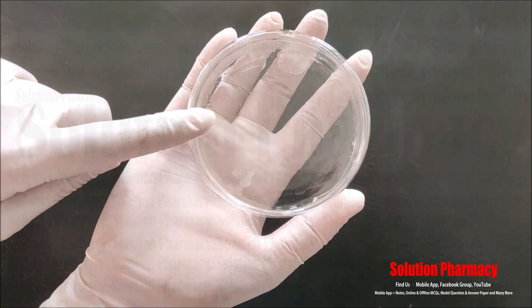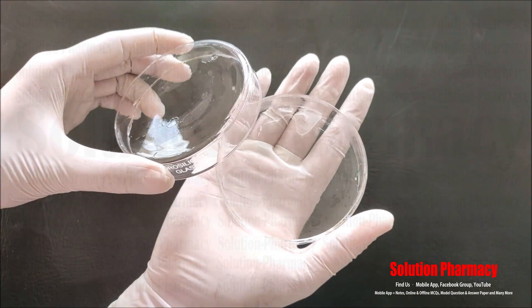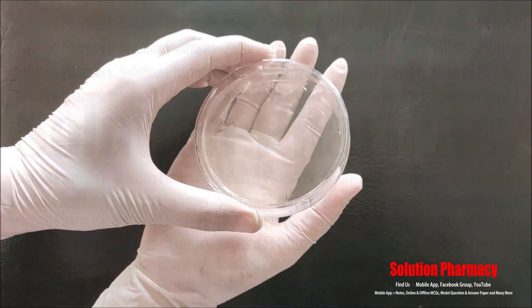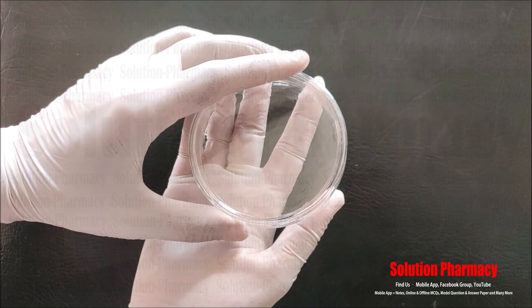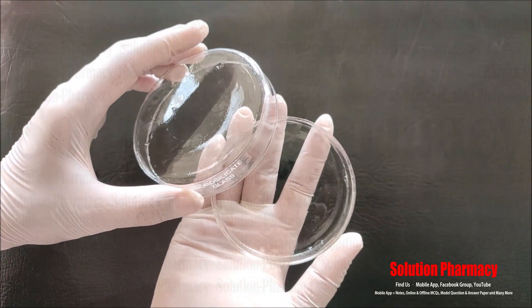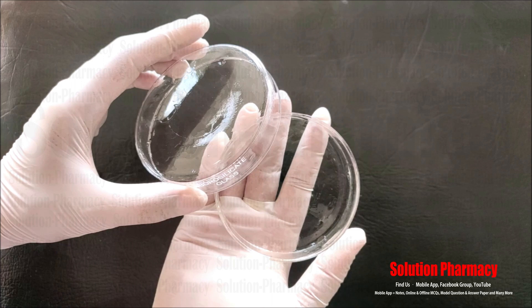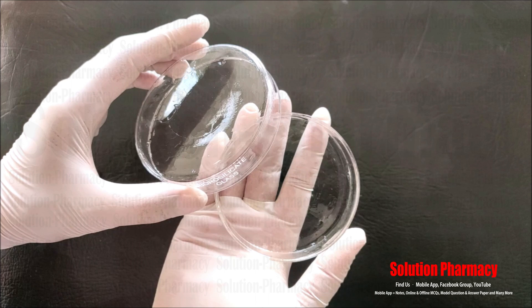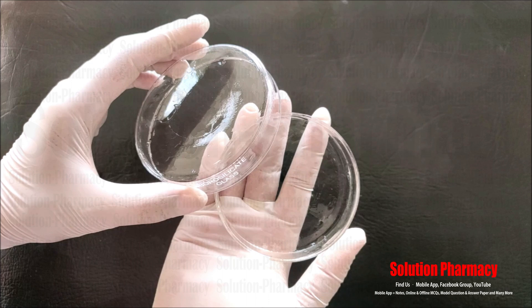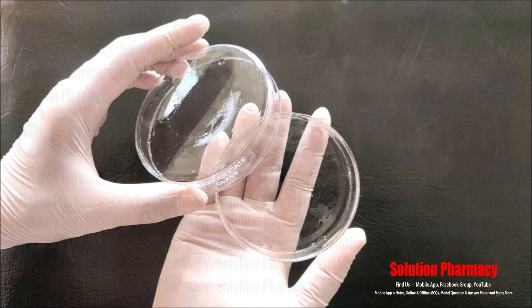Next, this glassware is called a petri dish, made of borosilicate glass. It consists of two parts — one for placing the substance and a cover. This petri dish is mainly used in microbiology labs for cell culture, such as microbial cell culture. Nutrient media containing agar is transferred to the lower part to solidify, then kept for bacterial or fungal growth. The cover is placed during cell culture to prevent contamination. It is completely transparent so that cell growth on the nutrient media can be easily observed.